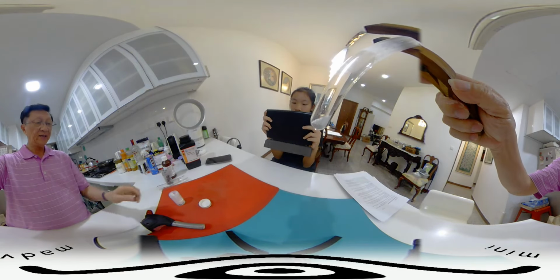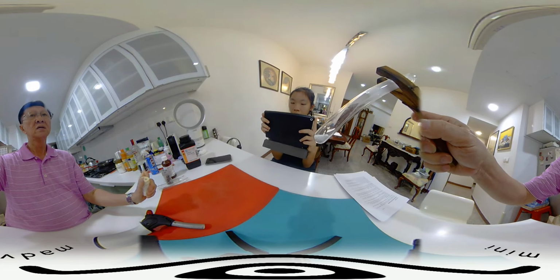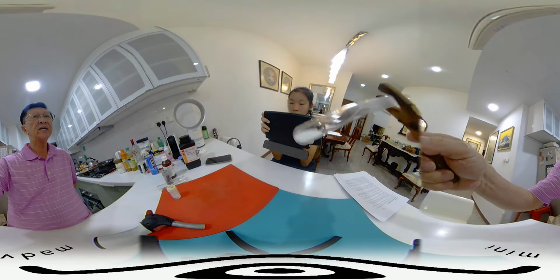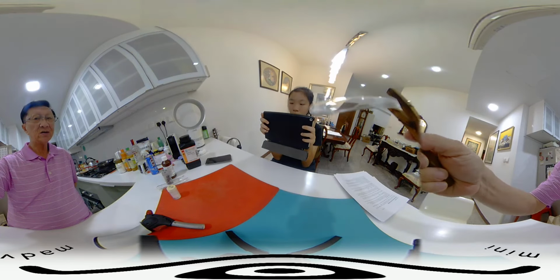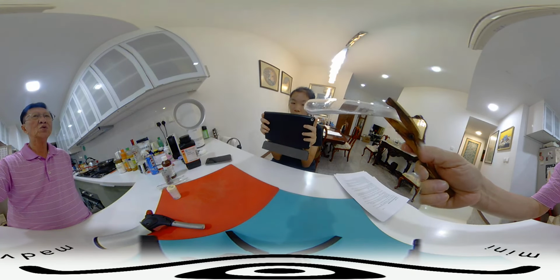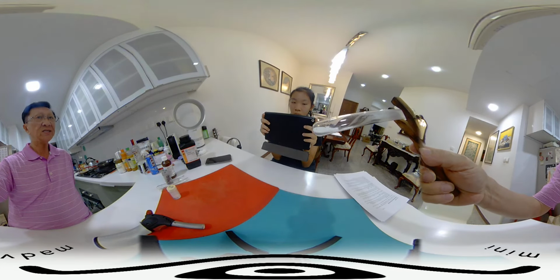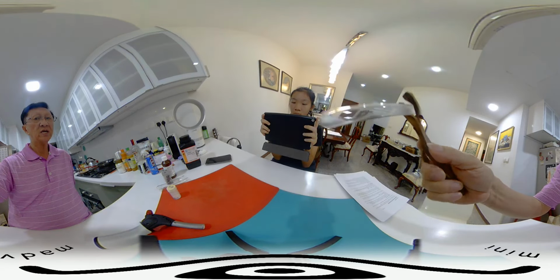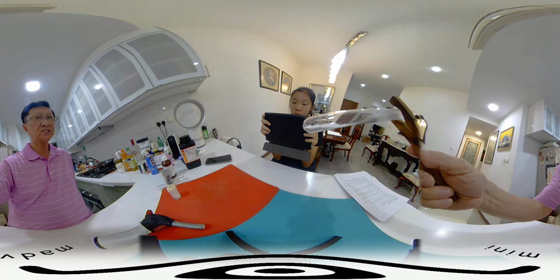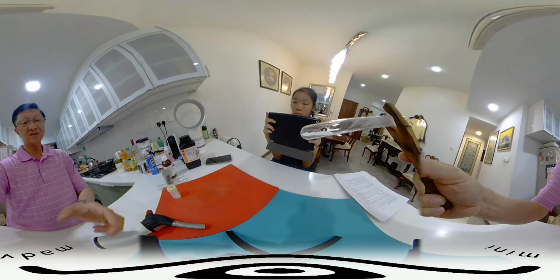Okay? And zinc oxide is in the group of metals called transition metals, and transition metals have colors, and zinc oxide is lumped with the colored compounds because of this change of color and nothing else. But most zinc compounds, if they are soluble in water, will give a colorless solution. Like zinc nitrate will give a colorless solution. Okay, but in this case, it is established that zinc oxide, the zinc is a transition metal because of this change of color due to heat. Okay, good. Stop.